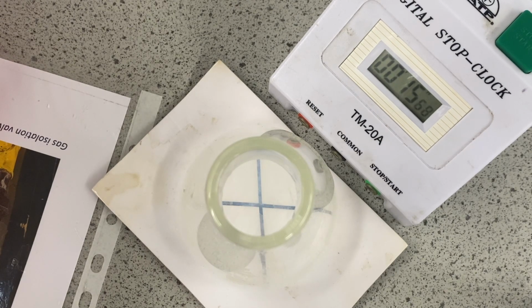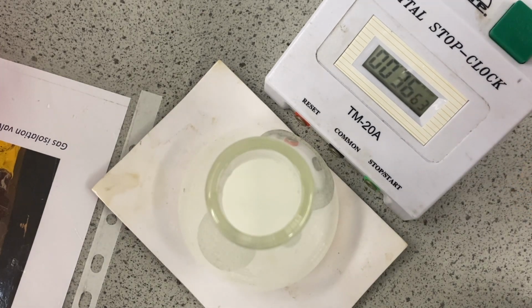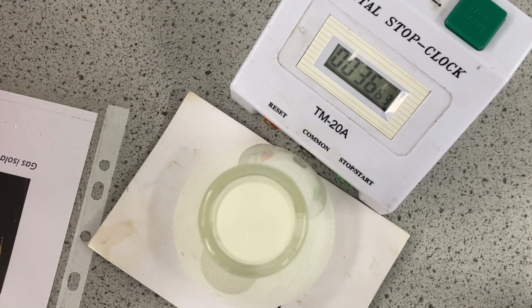As you can see, this one is going cloudy quite a bit quicker. And you see the pretty swirly pattern that it's making. And it smells very much of eggs at the moment. Sulphur's got quite a strong smell, so we get that sulphury smell produced. And stop. I think it was 35 when I tried to push stop the first time, wasn't it? Okay, so we've done all 3.